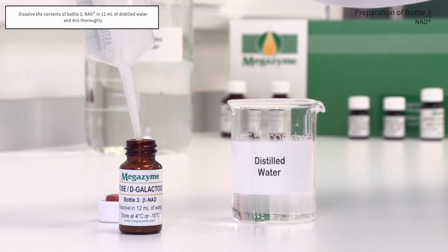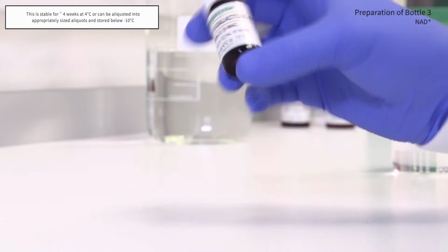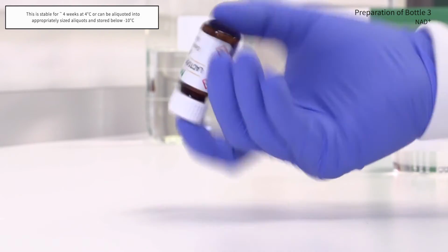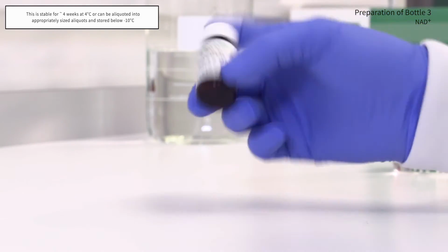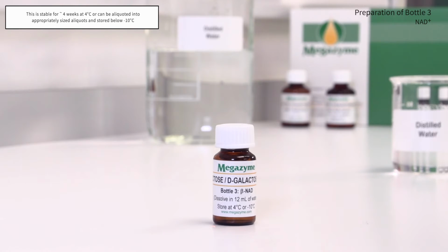Dissolve the contents of bottle 3, NAD+, in 12 ml of distilled water and mix thoroughly. This solution is stable for approximately 4 weeks at 4 degrees Celsius, or can be aliquoted into appropriately sized aliquots and stored below -10 degrees Celsius.